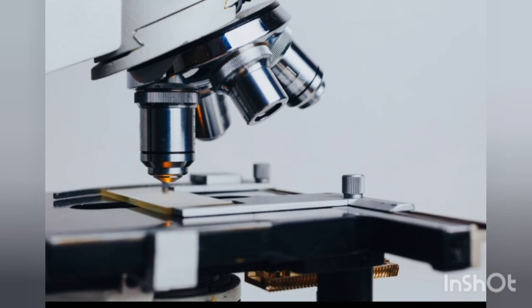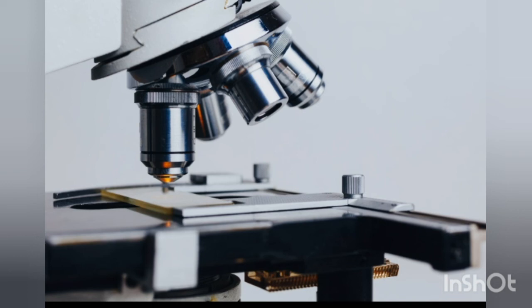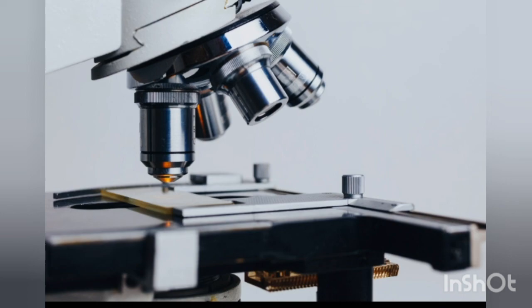When the objective lenses are attached to the revolving nose piece — which is also called the rotating piece — the plate can rotate or revolve, and the objective lenses rotate along with it.